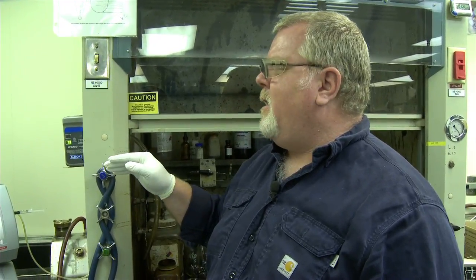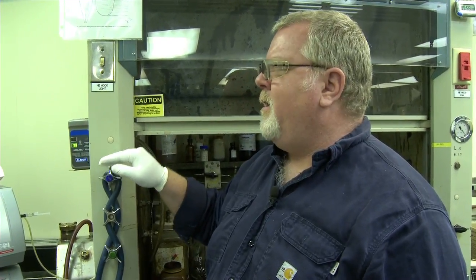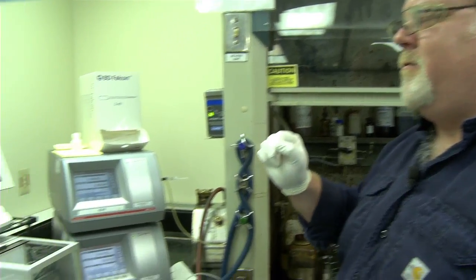It essentially has to be a homogeneous liquid to put in there. If there's 2 phases, for instance, if I end up with an air bubble in there or some free water in a sample, then it'll error and I won't get a valid result. So we put a homogeneous sample in there, run it through the tube, and push go, and it spits out a result for us.